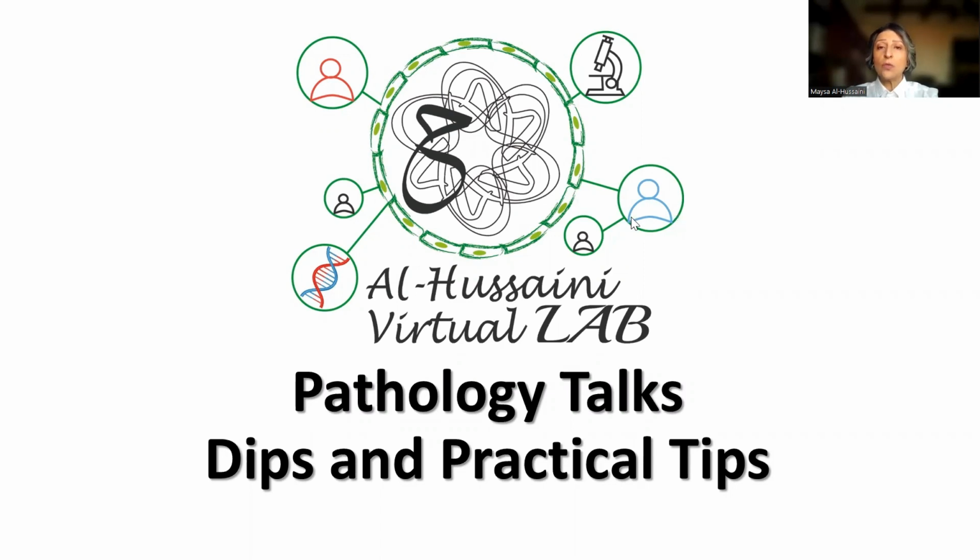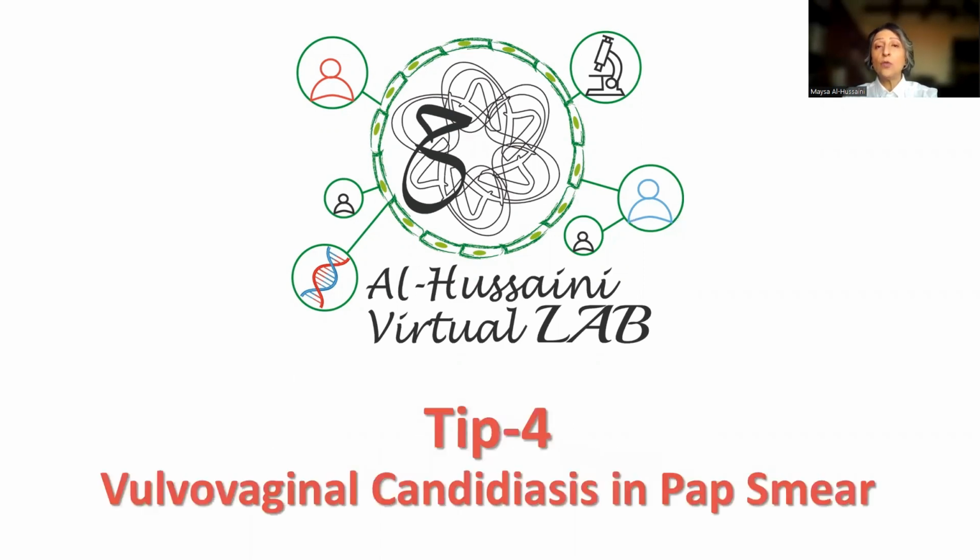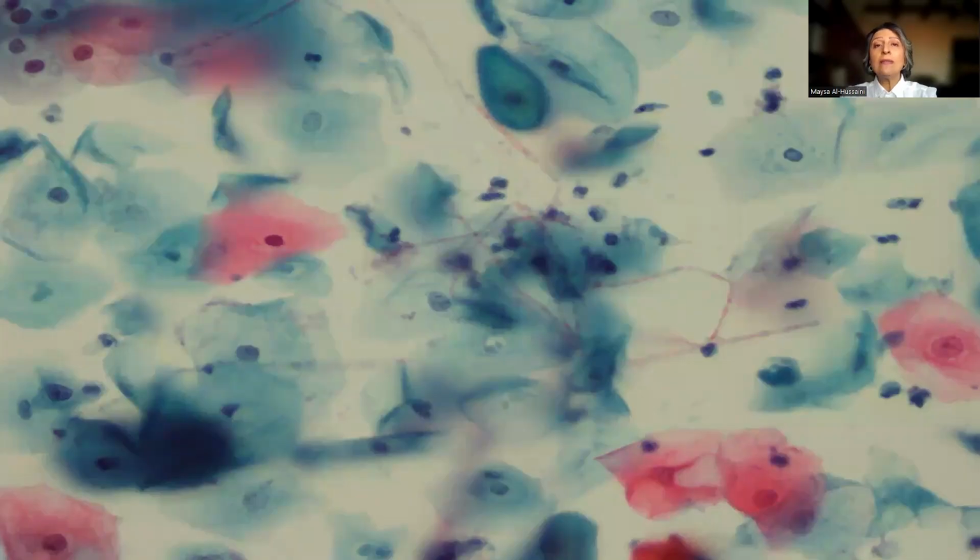Today we're going to address one important practical tip that we might encounter while reporting Pap smears, which is the presence of Candida in Pap smears. Now remember that frequently Candida can be encountered in Pap smears. Up to 3% of Pap smears can show Candida, whether this is associated with symptoms or quite often asymptomatic. What we see is actually the presence of a tangle of threads among the squamous epithelium.